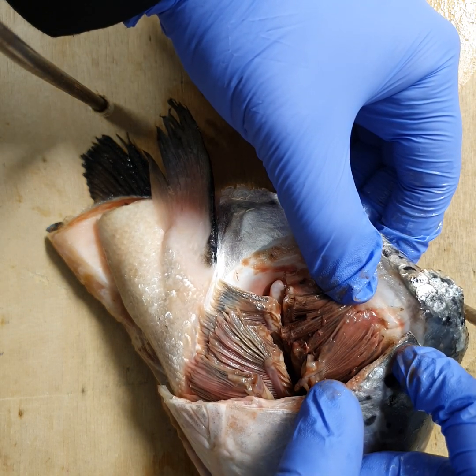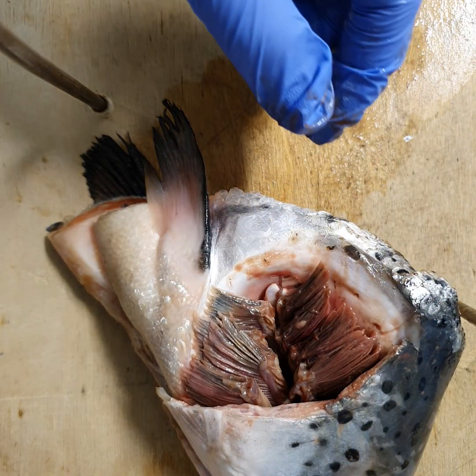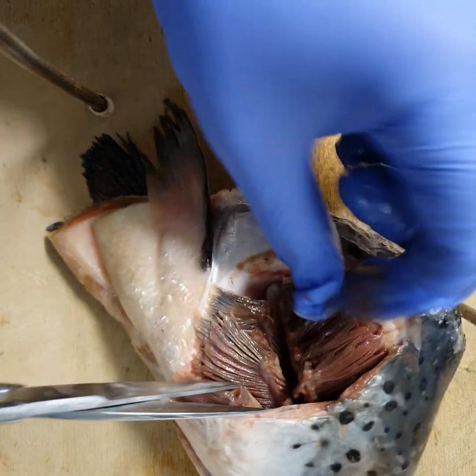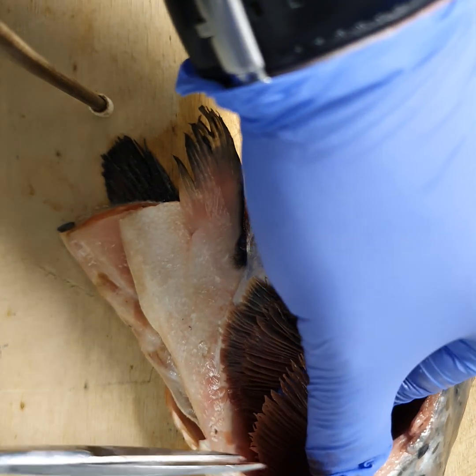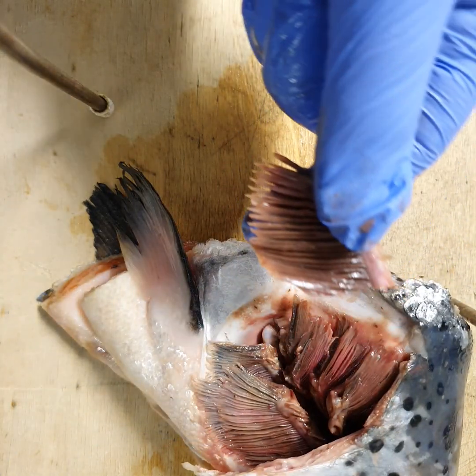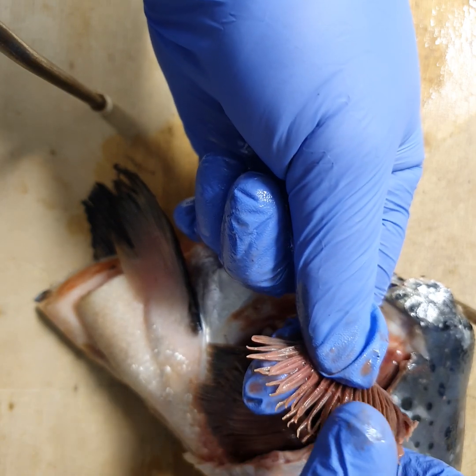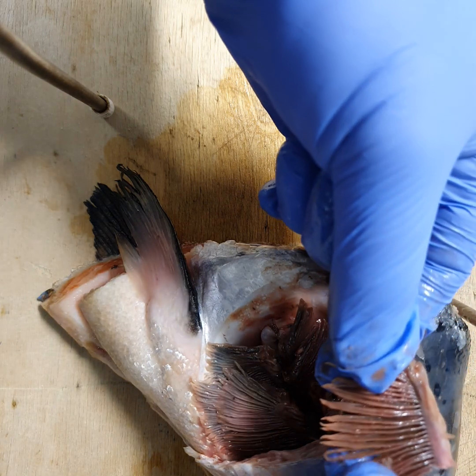I'm going to cut out one of the gill plates for you to look at. It almost looks like a brush. If I put this in a beaker of water, you would see it expand massively and it would almost look like hair coming out.